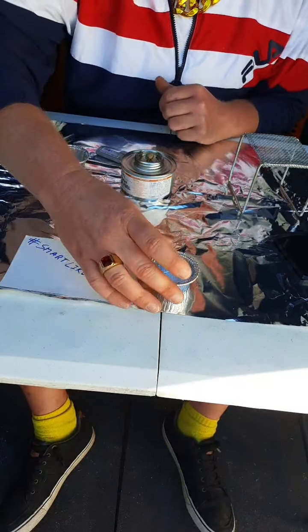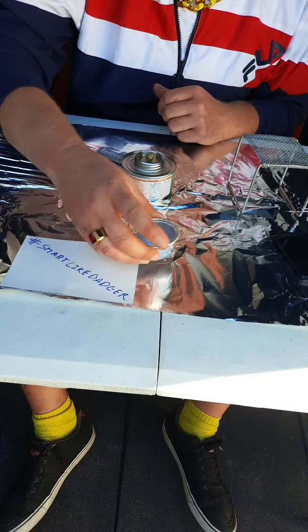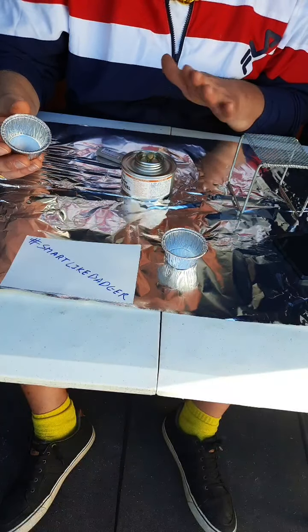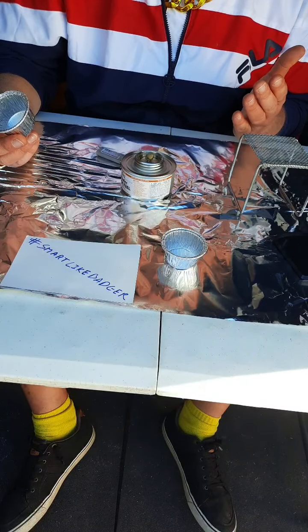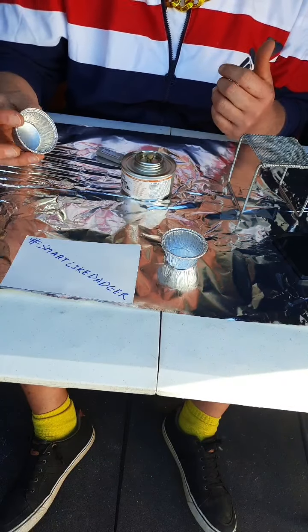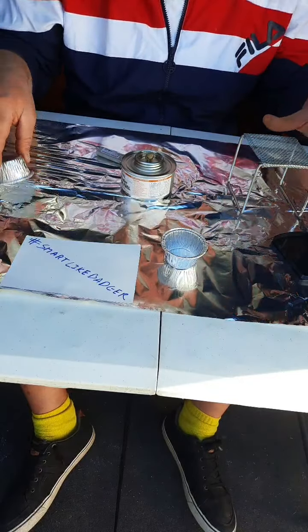Okay. This cup has the 2.0 grams of our sample. This cup is for safety. If this thing gets out of hand, I can put the cup on this. Boris also recommends you probably have a bigger type of cup made of metal, or just any kind of something else to smother it in case this is too small. Could be a cookie sheet, aluminum foil to go over.